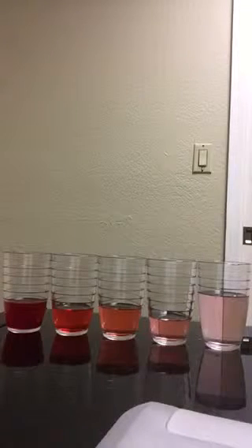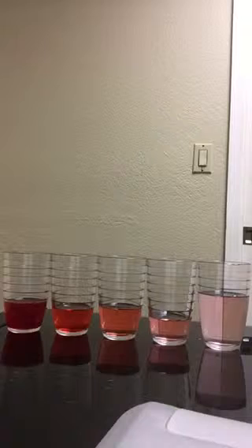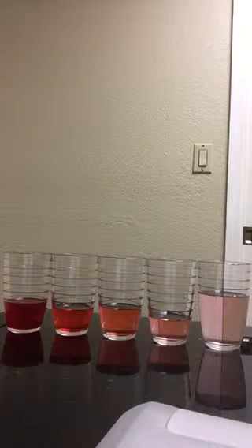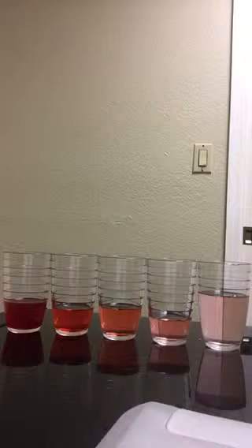Hello! In this video, I will be explaining how I conducted this lab on making a concentration series of solutions. As you can see, I made 5 solutions, all of which have varying concentrations. I used glass cups in order for you to clearly see the colors in each solution.